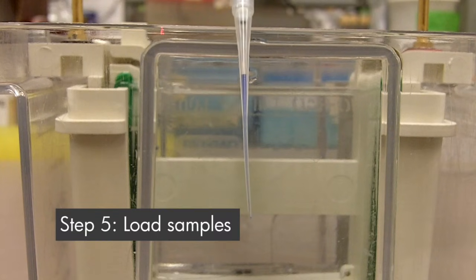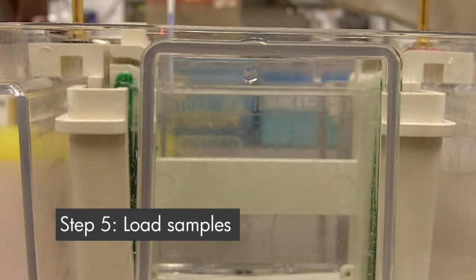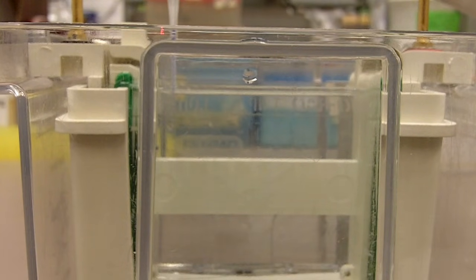To load a sample, insert the tip very close to the bottom of the well and then expel your sample. Again, you insert your tip to the bottom of the well and then you just push out your sample like that.